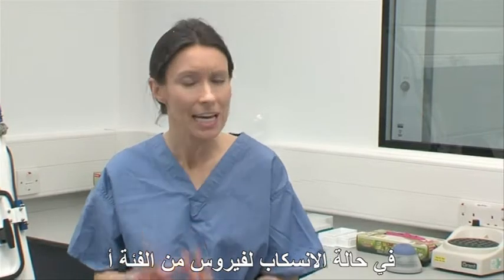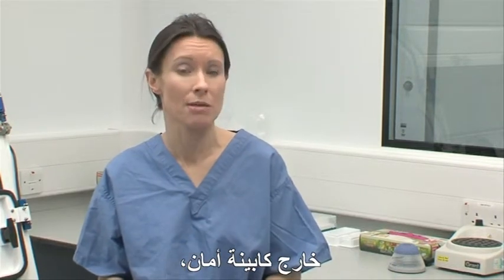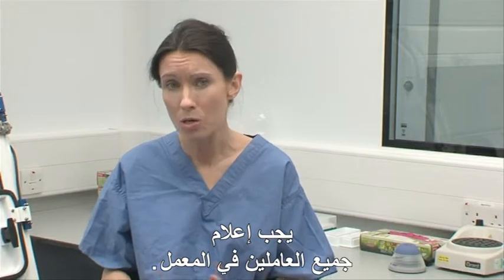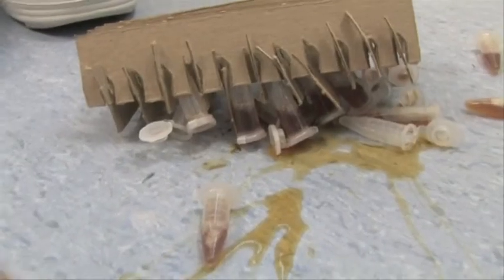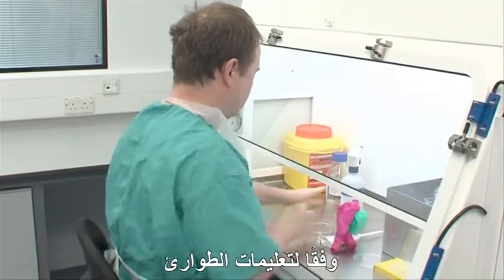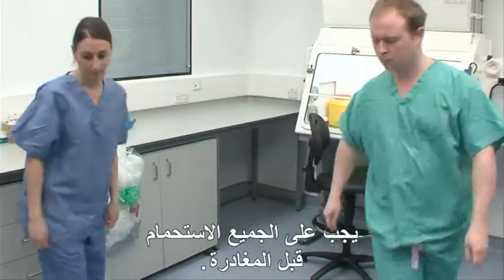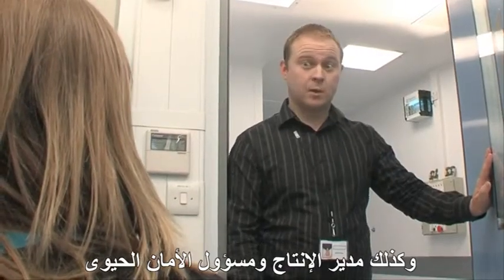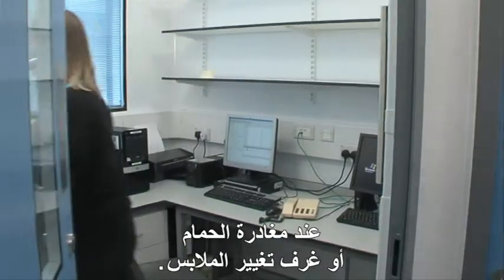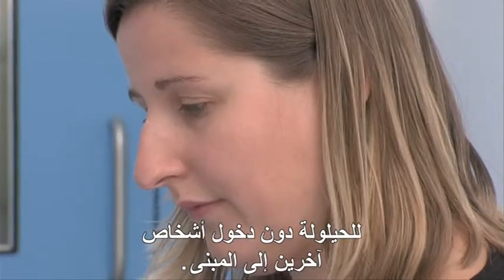With any spill involving Category A viruses or a large spill involving a Category B or C virus outside a safety cabinet, all personnel within the laboratory must be notified. All staff must vacate the facility immediately, according to the contingency procedures detailed in the risk assessment. Everyone should shower out before leaving. The incident must be reported to the building officer, line manager and local biosafety officer on exiting the shower or changing room facility. A warning sign must be placed on the shower doors showing the details and time of the incident to prevent anyone else entering the building.